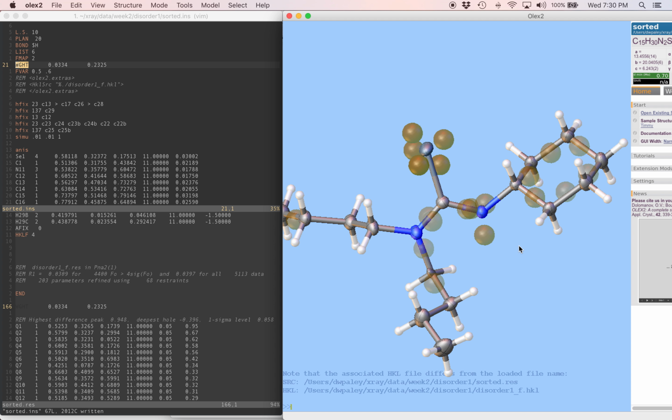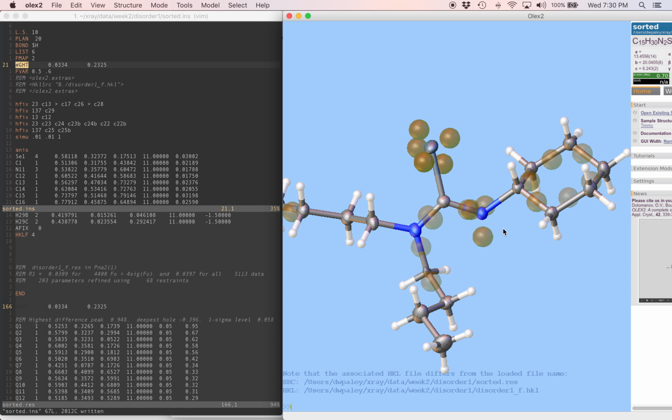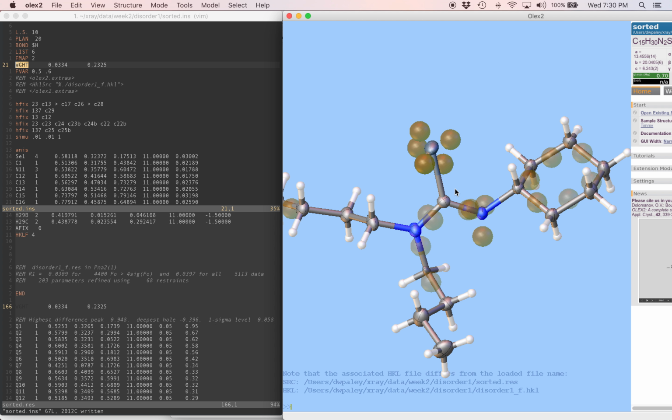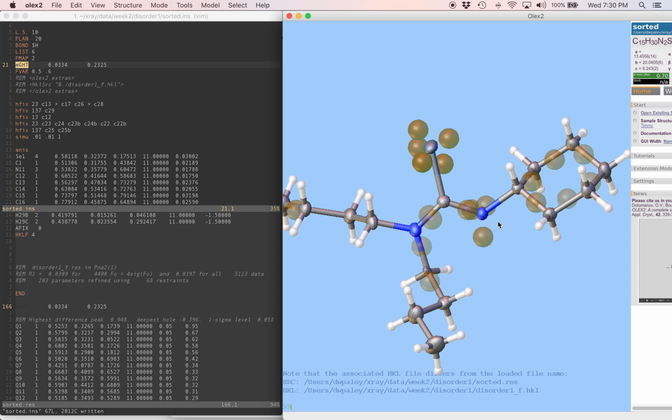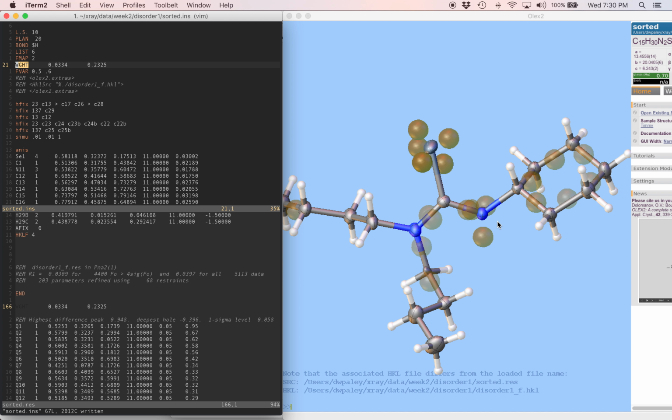We haven't talked about hydrogens so much yet, and we're not quite going to go into a ton of detail about putting this in perfectly, so instead we'll get it just about right. It's part of a selenocarbonyl, and that means it's going to be planar, so we'll just use the default planar NH HFIX instruction, which is 43. Same as for a planar CH. I'll put that in our ins file with the other HFIXes. HFIX 43 N11.